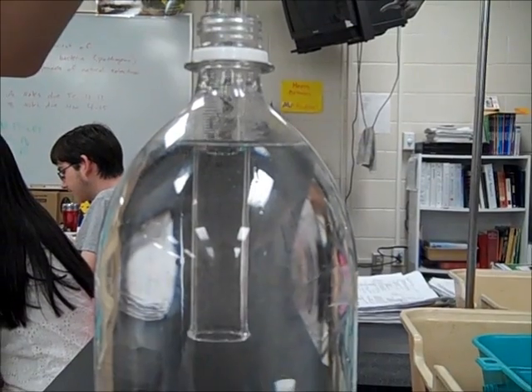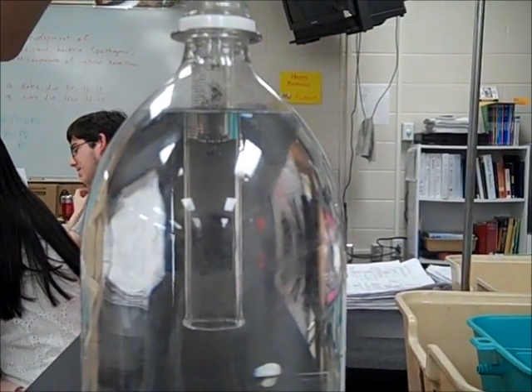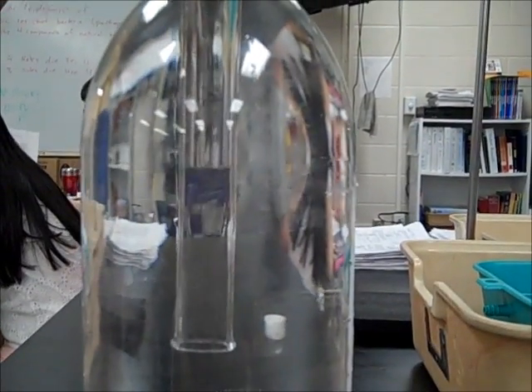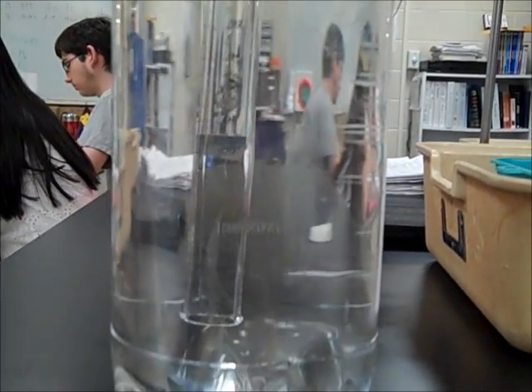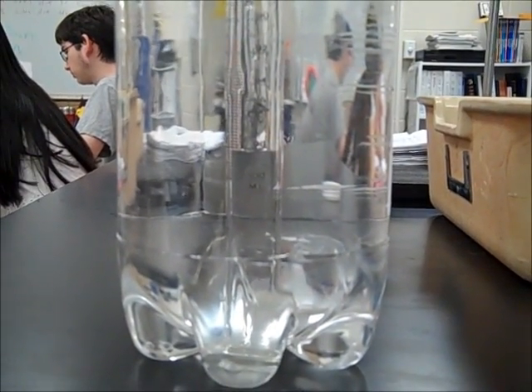And lower just a little bit, okay, and now back down to the bottom, all the way down, and that's good right there, thank you.